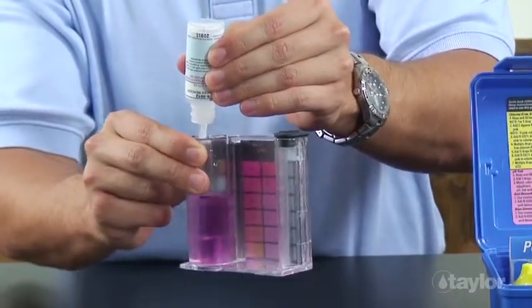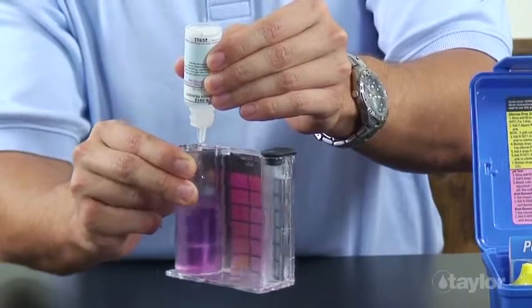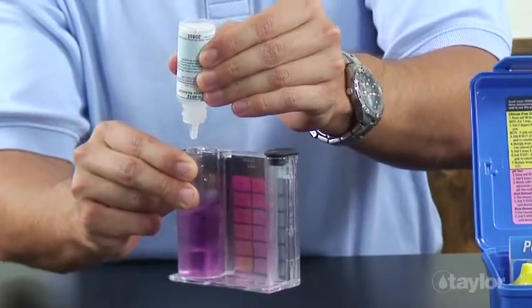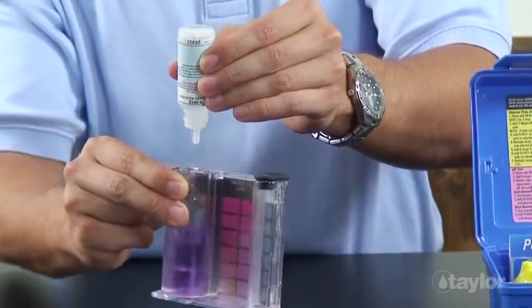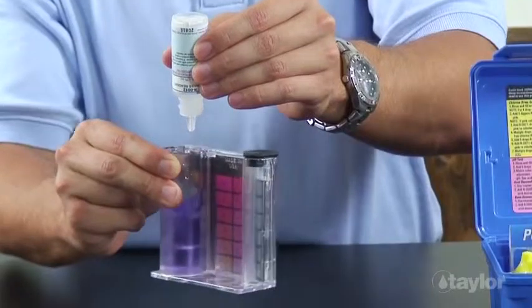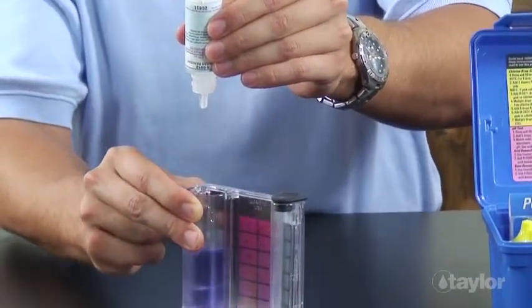Add the number of drops used in this step to the number of drops of reagent 12 used at the beginning of the test. Then multiply the result by 10. Record the result as parts per million calcium carbonate.